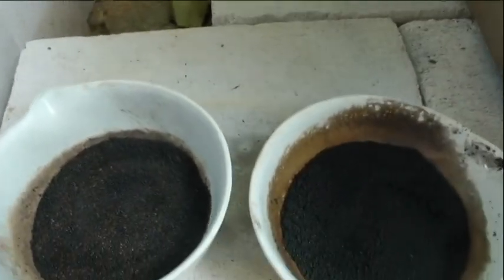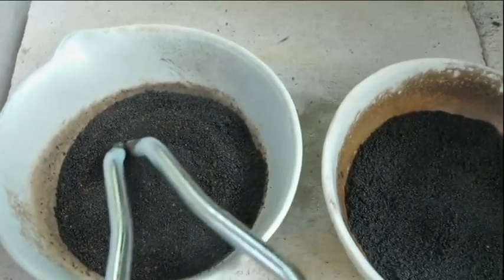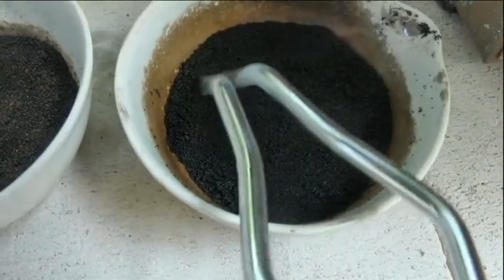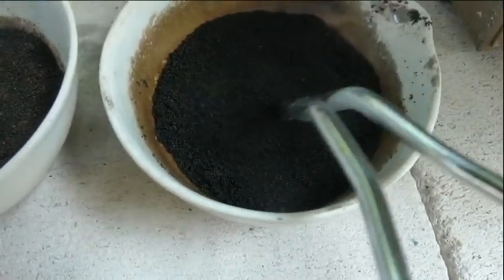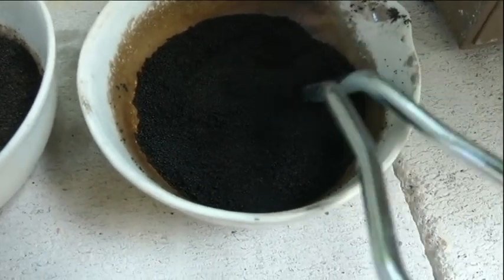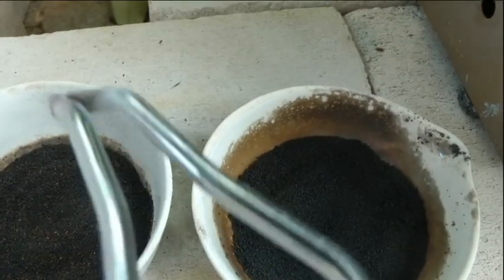But that seems to be a whole lot better now, with each individual little bead not all fused together. I'm ashing it a lot slower and taking a bit longer, but I think that's a better result. This should have gold in it.